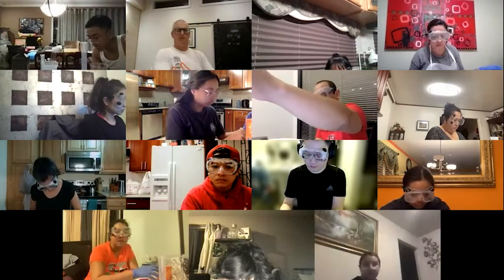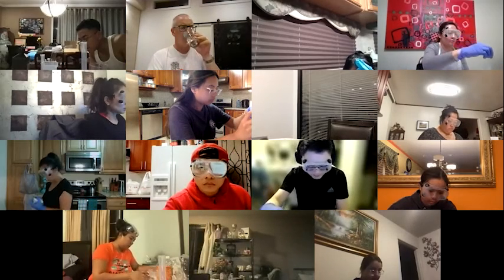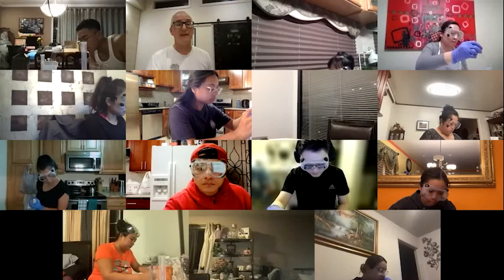I don't think there's, unless maybe something dropped when I burned it that first time. Could be. With sodium bicarbonate and acetic acid, you generally don't see a precipitation because everything is super soluble. Acetate's super soluble. Carbonate is pretty soluble, unless there's calcium or something else around. So if that's tap water, you could have a lot of calcium in your tap water, and you're sort of seeing some precipitation from that.